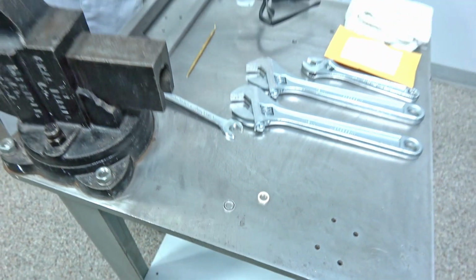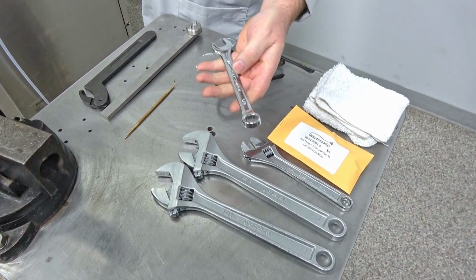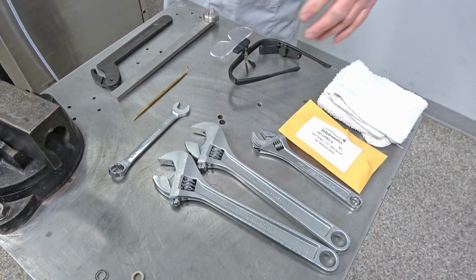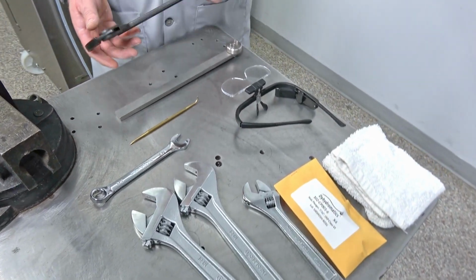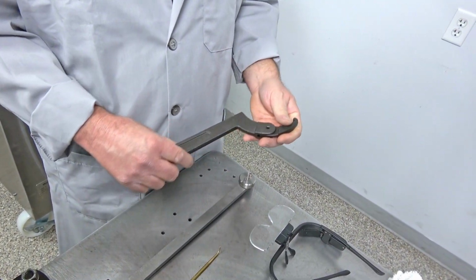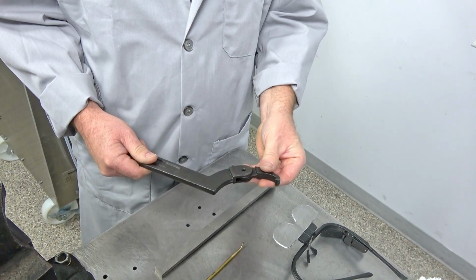And we're going to look at some of the tools I have here. You can see I have an assortment of wrenches. This is the main wrench, 5/8, the one that you use on most of the fittings over there. But I keep some adjustable wrenches on hand because you can use them for different sizes. And then we also have a spanner wrench here. This one is 2 to 4 3/4 if you want to pick these up on Amazon. They're not that expensive, but you can see it has the hook here.